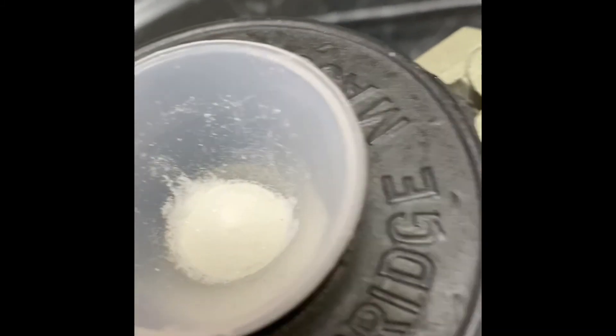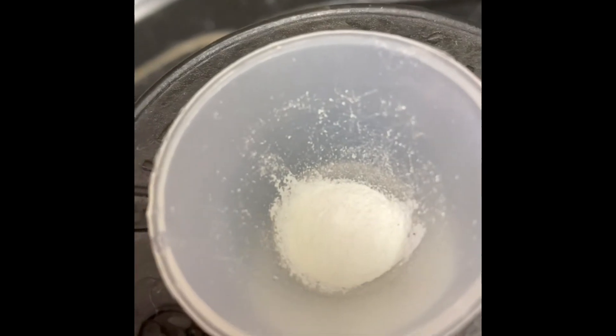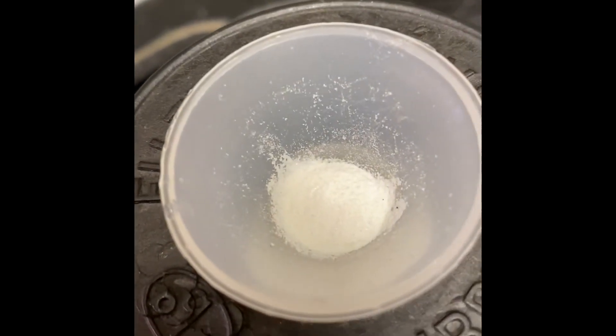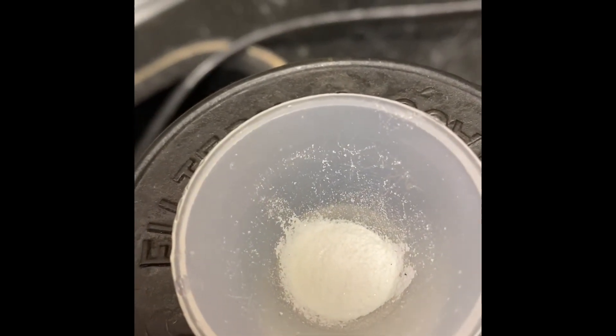That's how our product looks like. We're going to let it dry, and then we're going to do crystallization with the methanol.